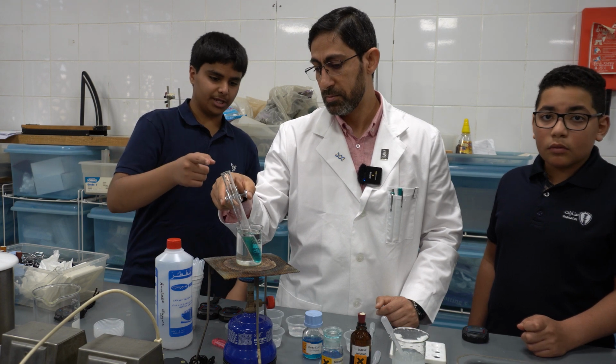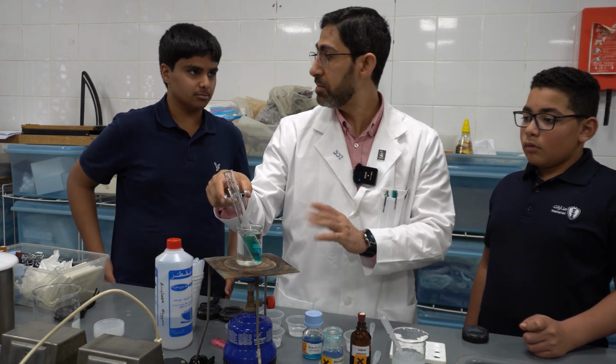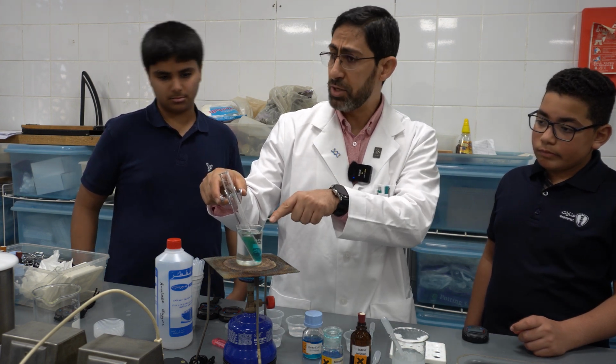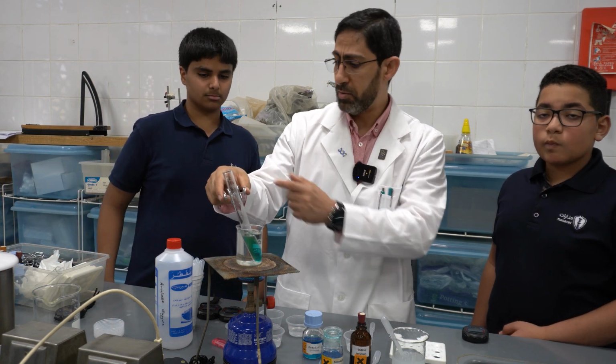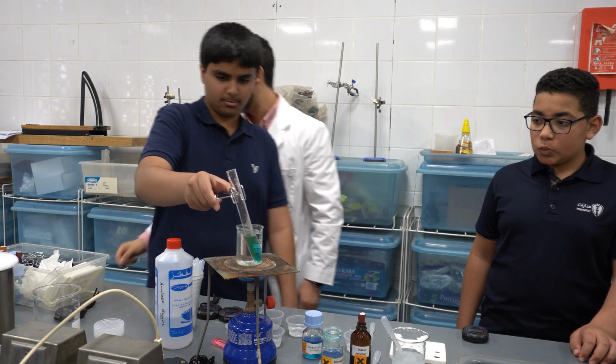Yes. If we increase the temperature, will the enzyme work faster, or will there be no breakdown? There is no enzyme now. It is the reagent. Now the color starts to change, by the way. It's now starting to become... okay, you can catch it. Carefully. I will use the cam.